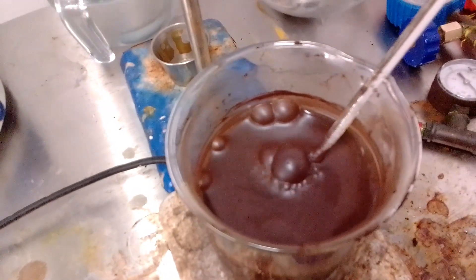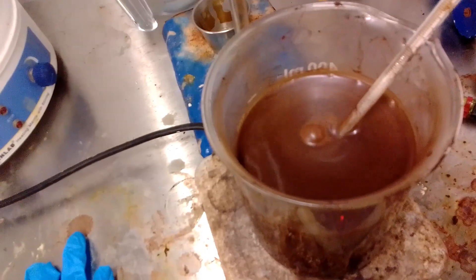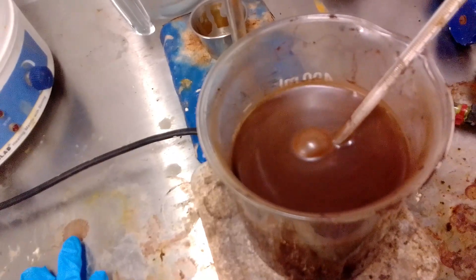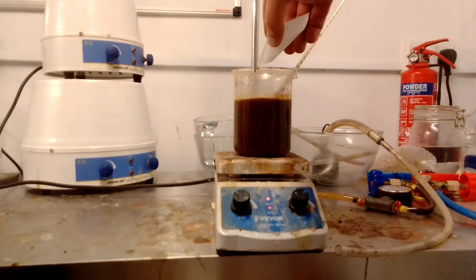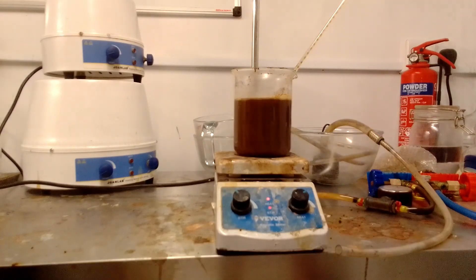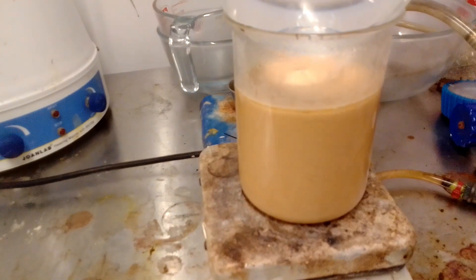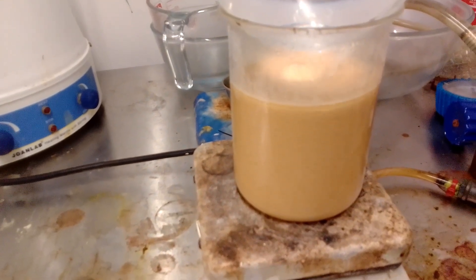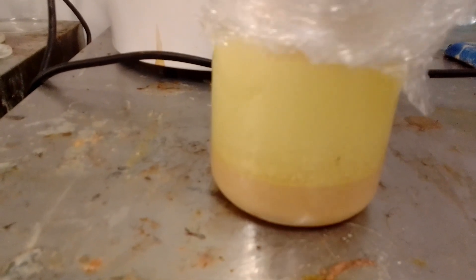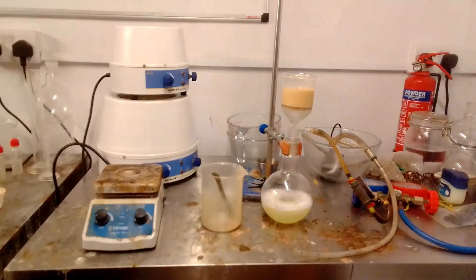With some caution I started heating it up. The mixture started effervescing as nitrogen was released from the diazonium salt, and the beaker was a bit too small to contain the head of iodine foam that started building up, which I had to stir manually to disperse. After the mixture had stopped foaming, I heated it to 60-65 degrees and held it there until effervescence ceased and the products precipitated from the mixture as dark brown and red solids. Any remaining iodine was neutralised with sodium thiosulfate, and the mixture was heated to 90 degrees, which cleared up any unreacted starting material and caused the product to lose much of its dark colour, most likely due to residual iodine. Since the mixture smelt strongly of sulfur dioxide, I'm guessing that was the active reducing agent. On cooling, the crude product was recovered on the pump as pale orange powder.